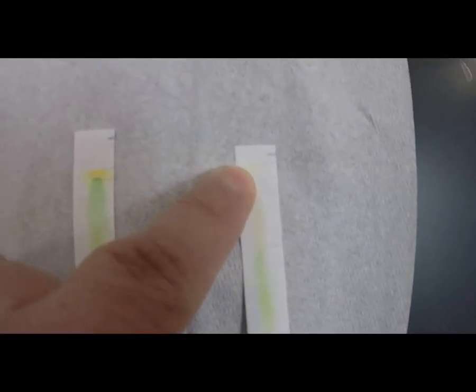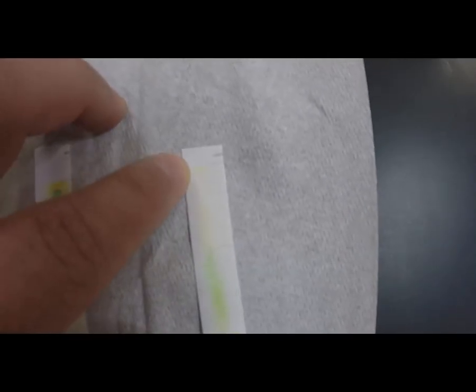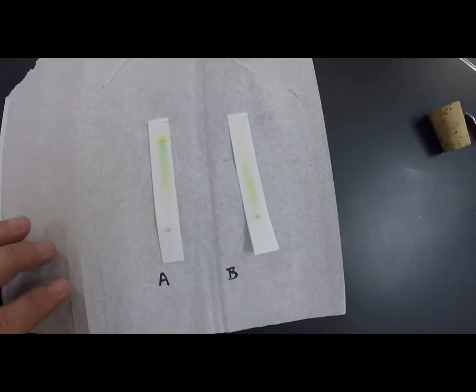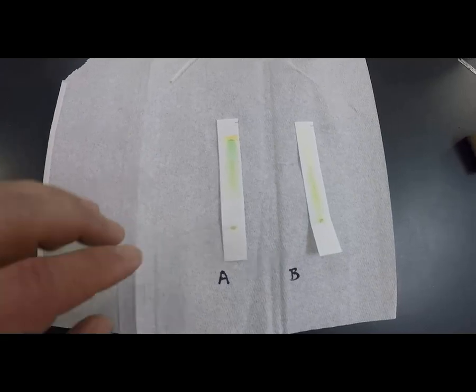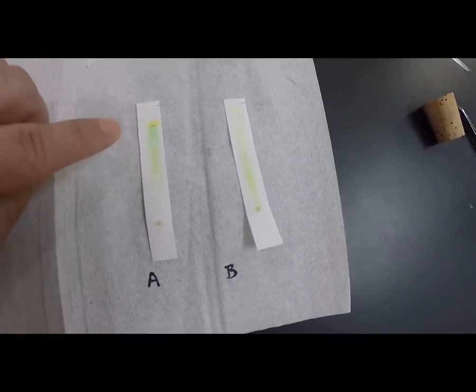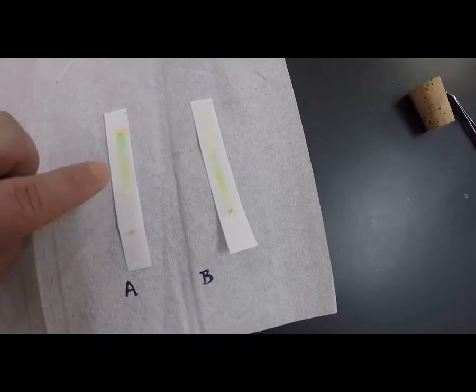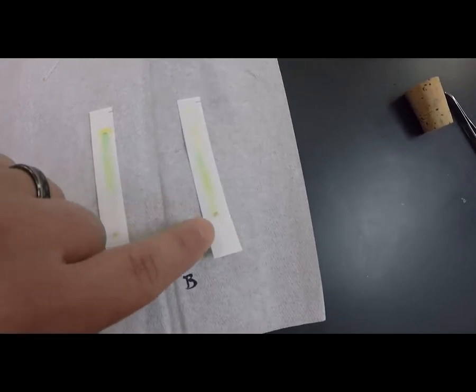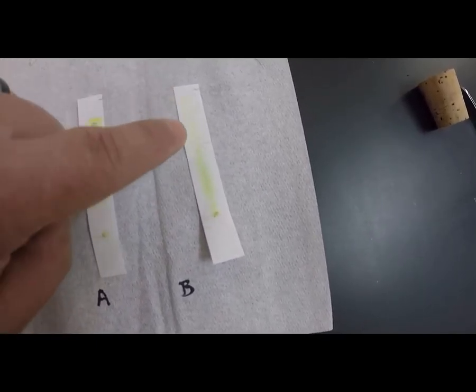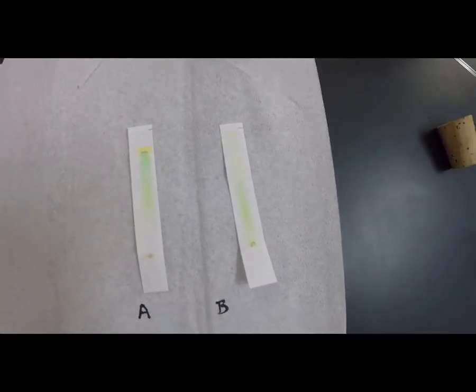And there's a better carotenoid pigment line than I saw in the money plant. So it looks like the money plant has better chlorophyll pigments, maybe even more chlorophyll pigments based on this. That's hard to tell, but at least a better pattern than the geranium, but the geranium seems to have a longer peak on both the xanthophylls and the carotenoids.